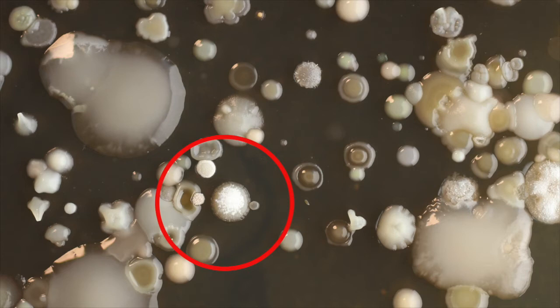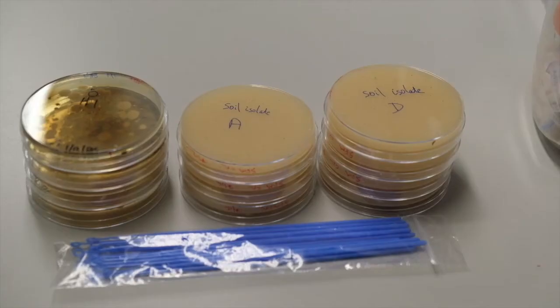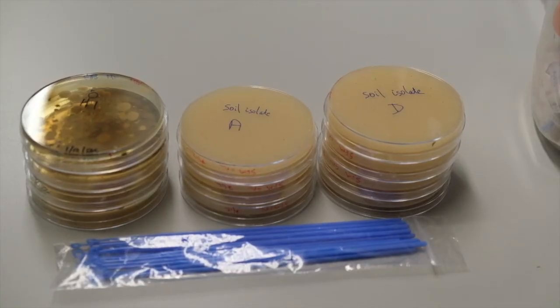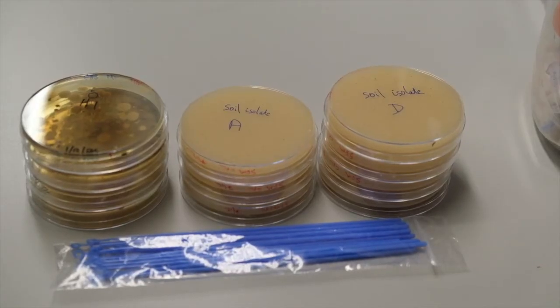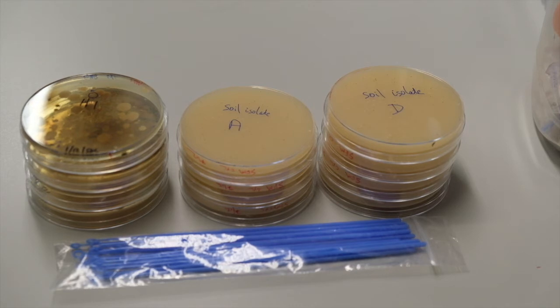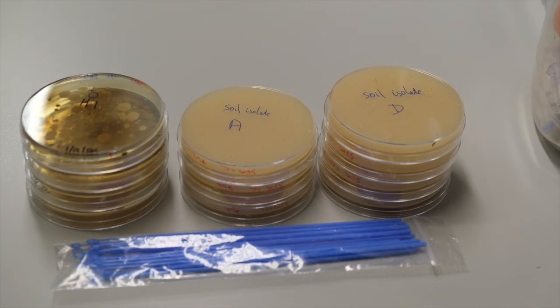All of the chosen colonies had the hard powdery appearance of streptomyces. We will pick the chosen colonies from the Gause number two plates and streak them to single colony on soya flour mannitol plates.